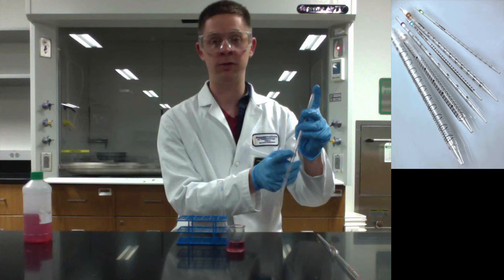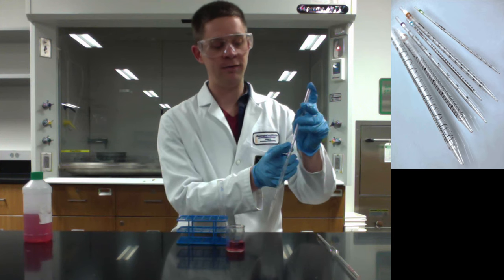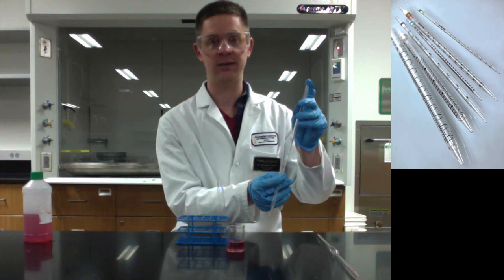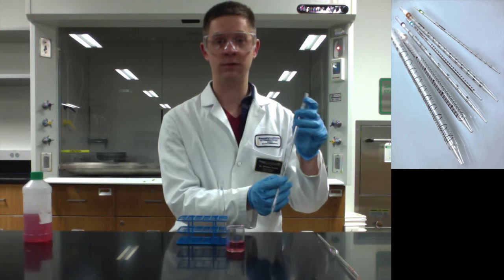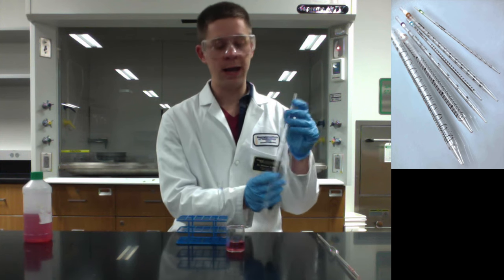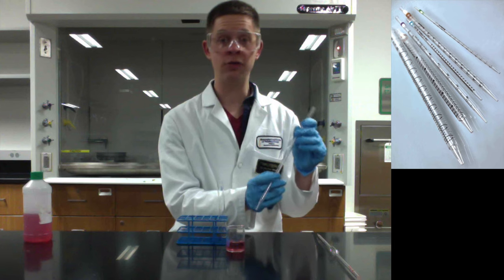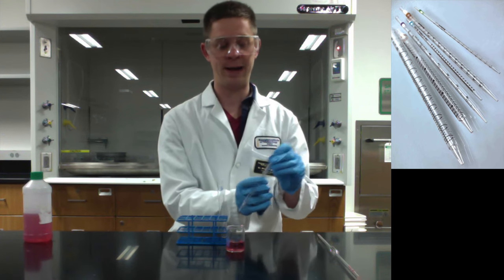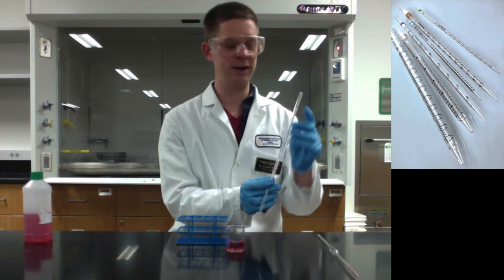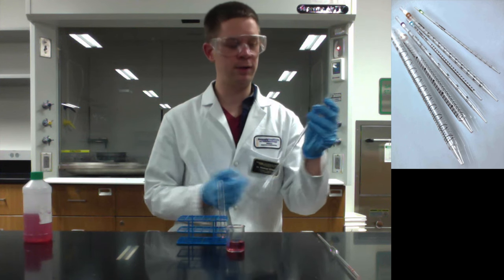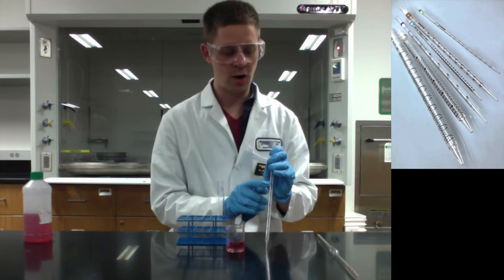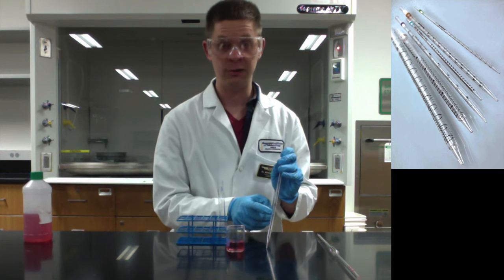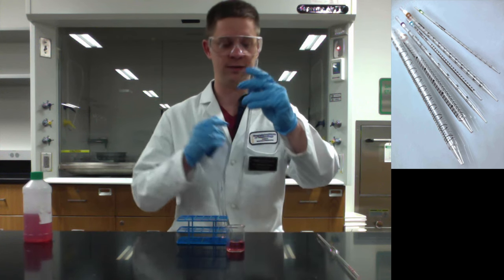So you can fill up to zero and then ease up off your finger to deliver liquid down to the 2.6 line. That's probably the easiest way to work with this. It also prevents contamination to some degree because you can fill up to the zero line and then deliver back into the beaker just a very tiny amount of liquid. So you'll see what I mean in a second. Bottom line is our initial goal is to fill to zero and we're going to let this drip out into the test tube until we get down to the 2.6 line.